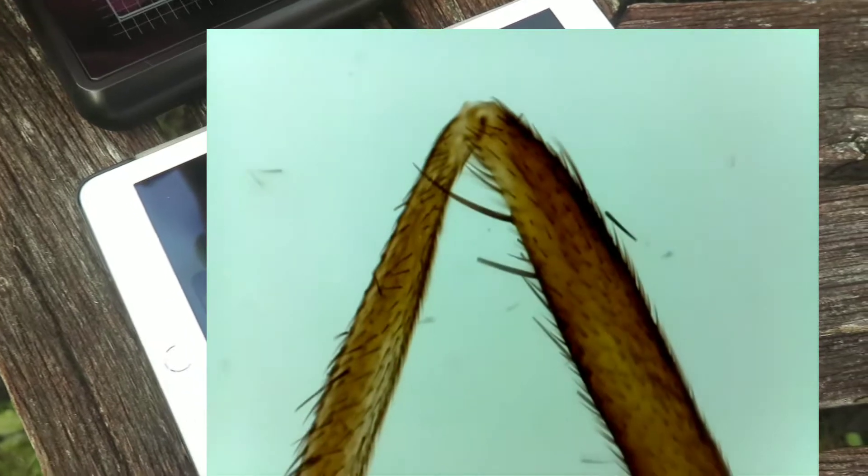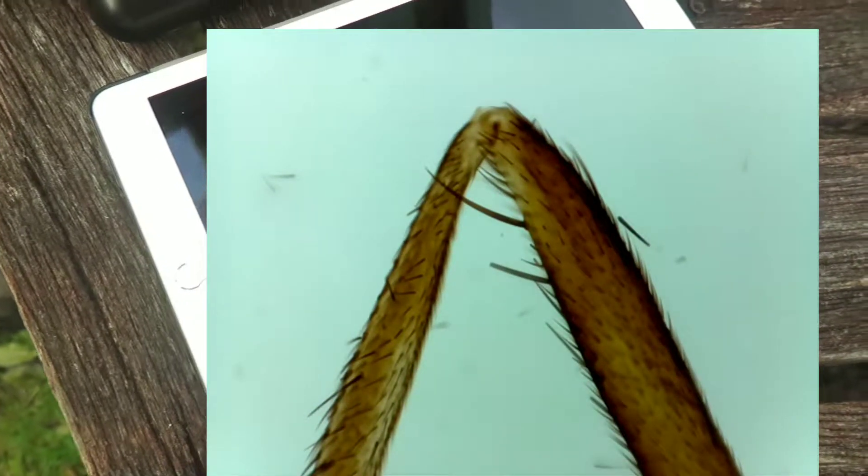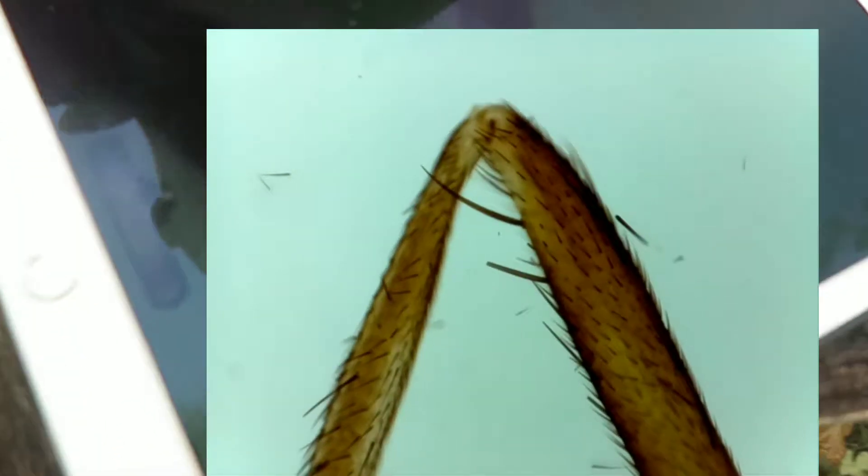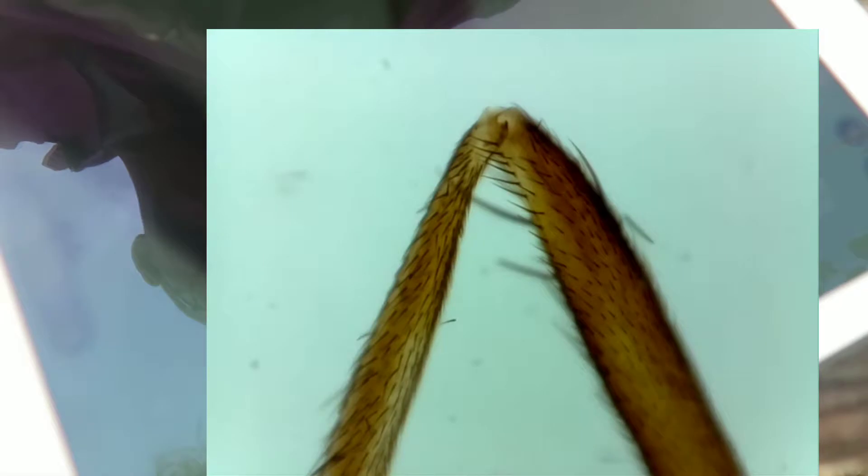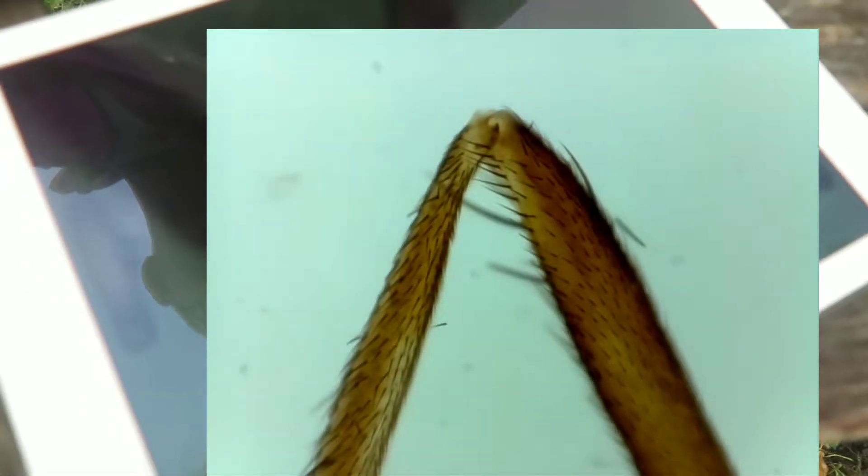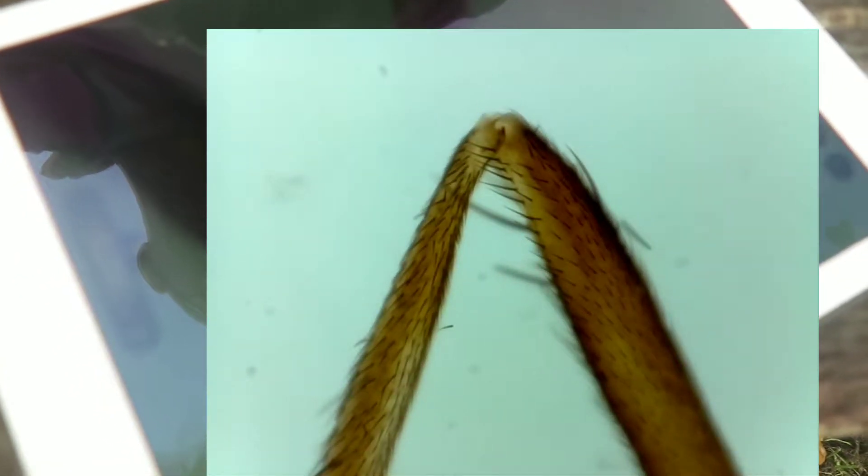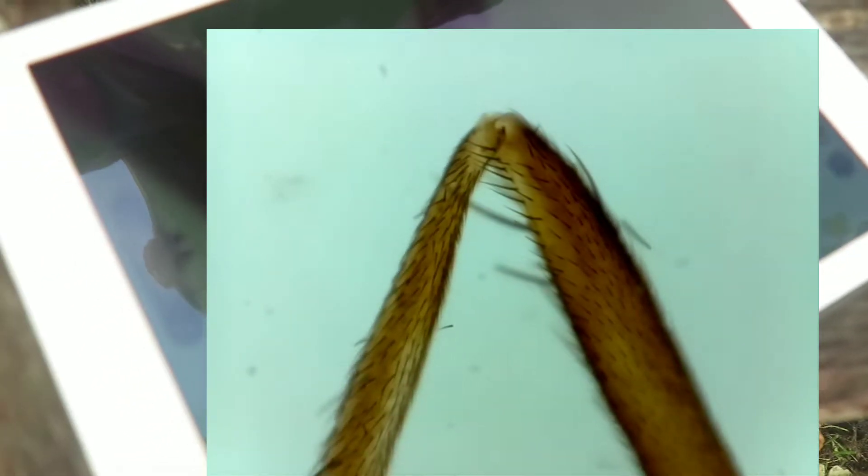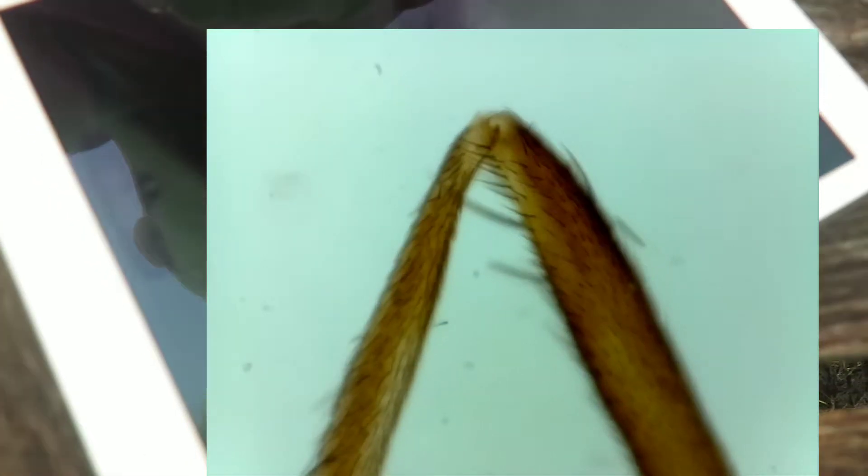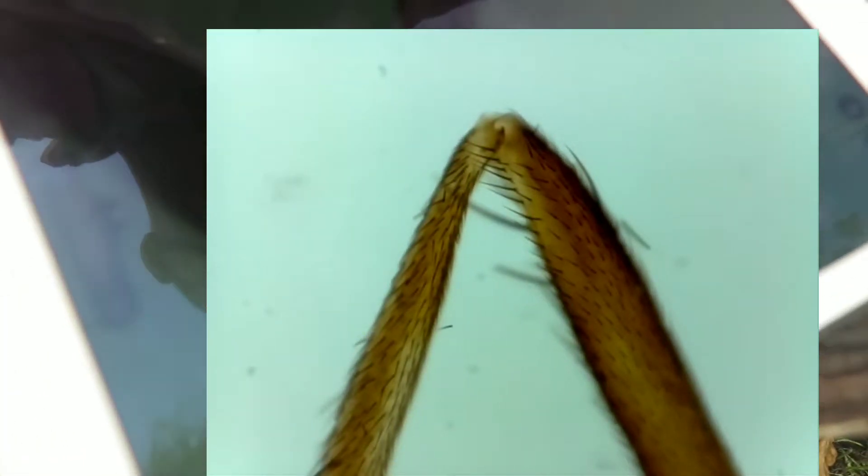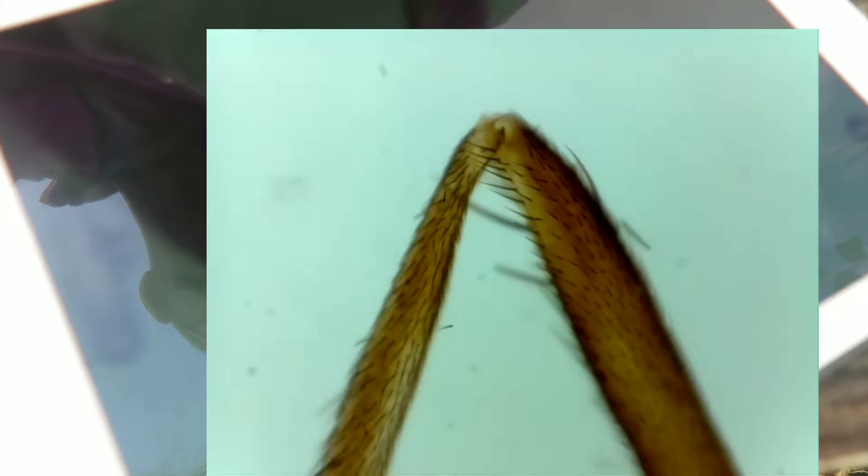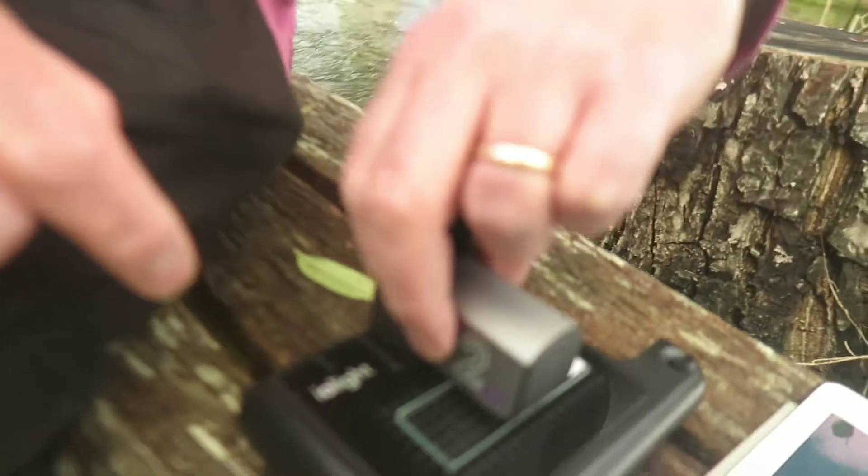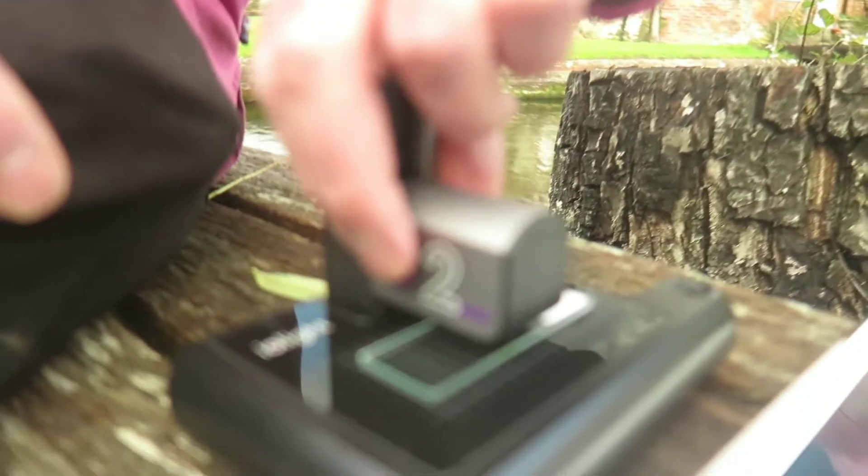So we can move, we can see the knee of this fly leg. Now the other thing you can see is that it's not quite in focus and so what we're going to do is we're going to use my hand again in the same position on the head just to get the focus absolutely spot on and you can see there it's getting nice and crisp. Using my hand on the microscope for focusing.